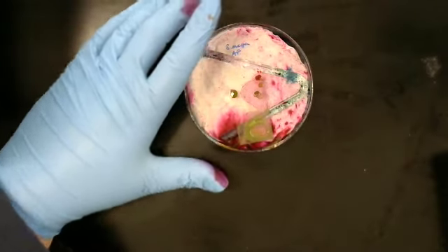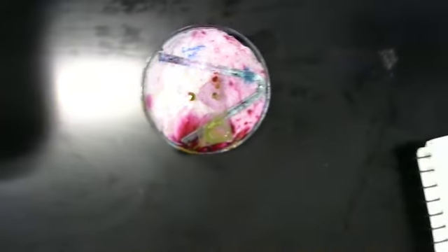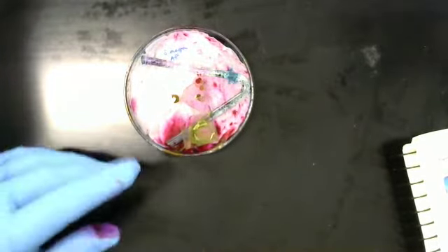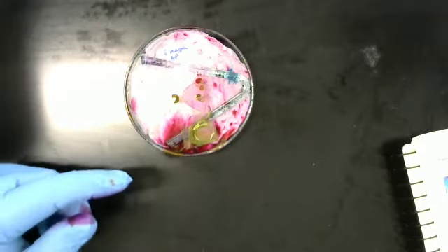The microwave is inside of a chemical hood, specifically just in case we do have problems, things like the stain cooking too long, boiling, that type of thing.